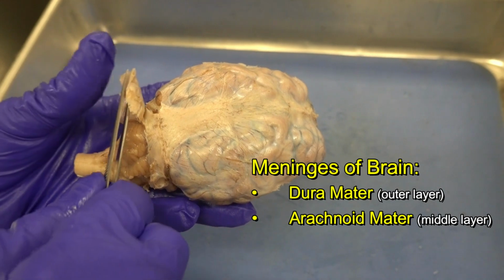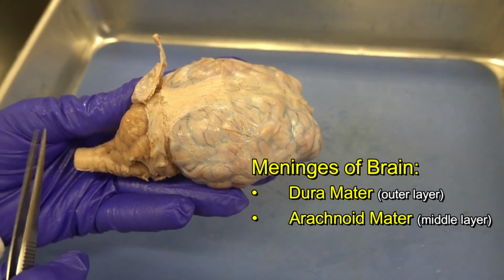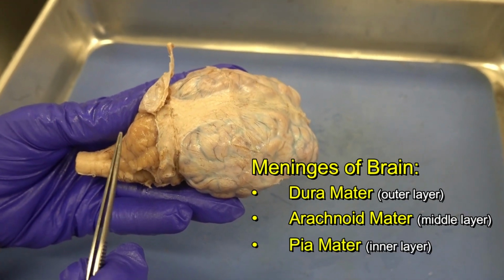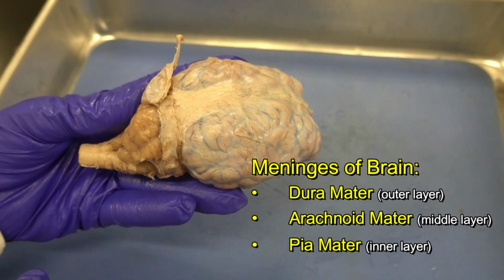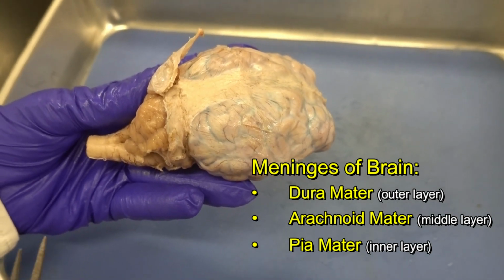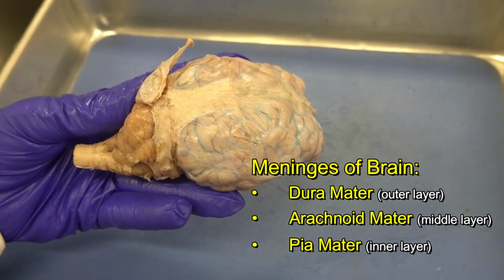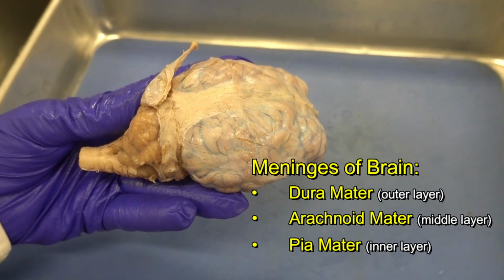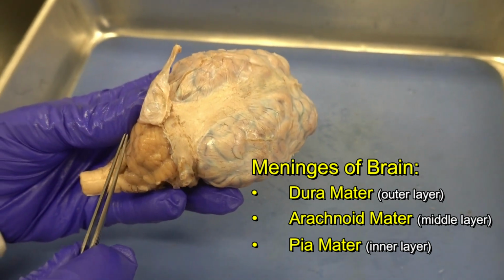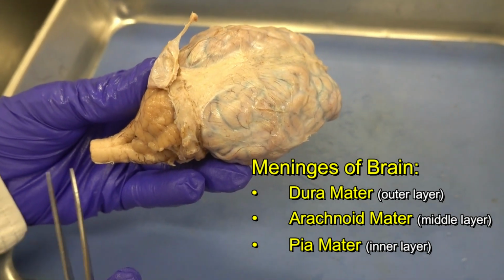And then when I remove these layers, I get to the deepest layer of the meningeal membranes, which is called pia mater. Pia mater is attached to the brain. It's thin, it's transparent, and it actually adheres to the brain. It contains bundles of collagen and some very fine elastic fibers. Pia mater has many blood vessels. Obviously, these blood vessels are used to supply oxygen and nutrients to the brain.